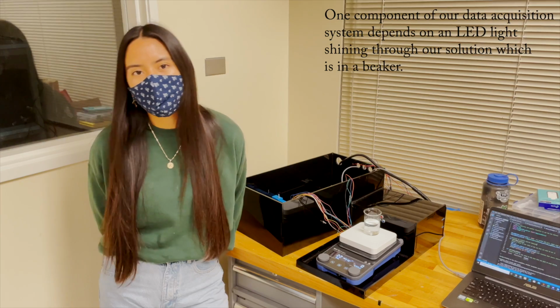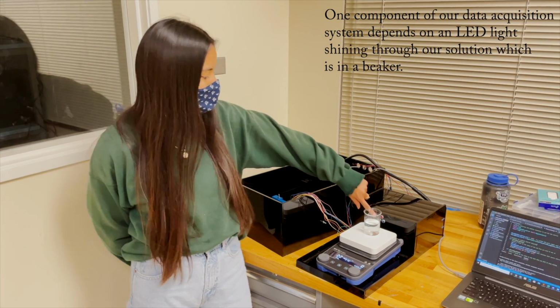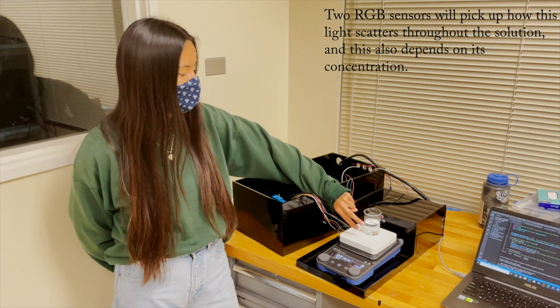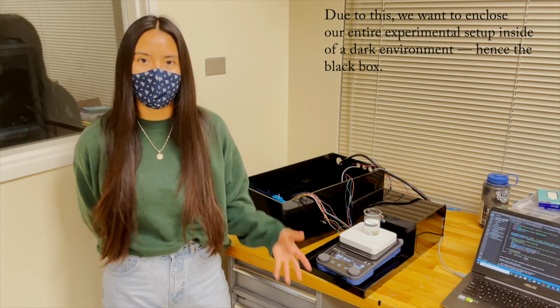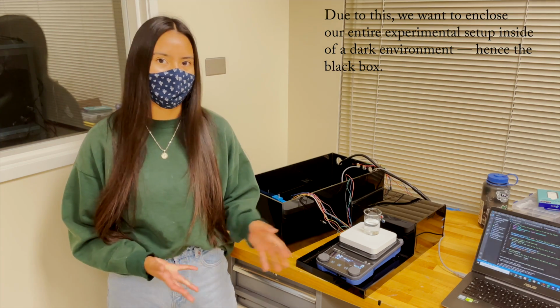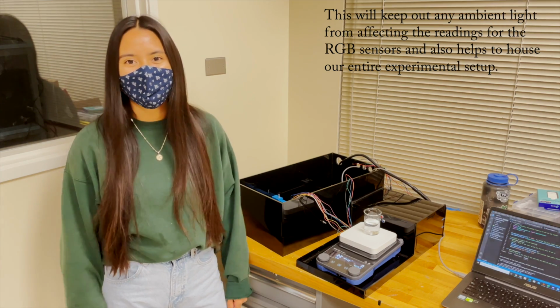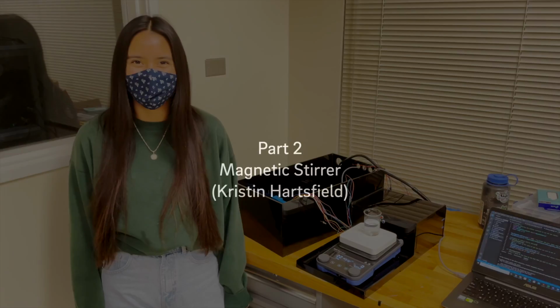One component of our data acquisition system depends on an LED light shining through our solution, which is in a beaker. Two RGB sensors will pick up how this light scatters throughout the solution, and this also depends on its concentration. Due to this, we want to enclose our entire experimental setup inside of a dark environment, hence the black box. This will keep out any ambient light from affecting the readings for the RGB sensors and also helps to house our entire experimental setup.